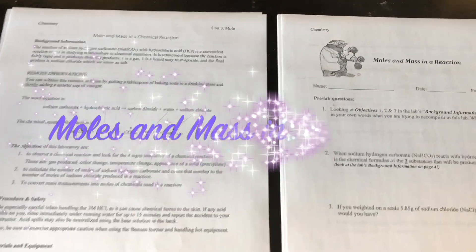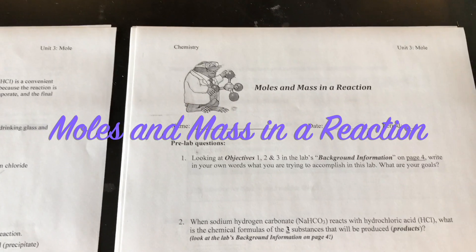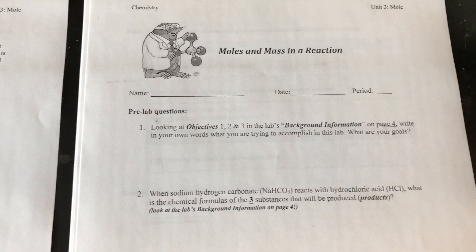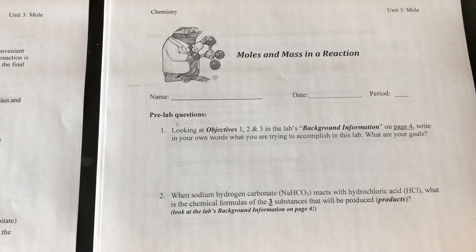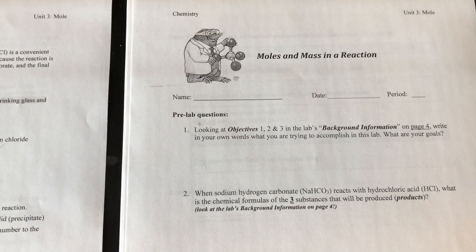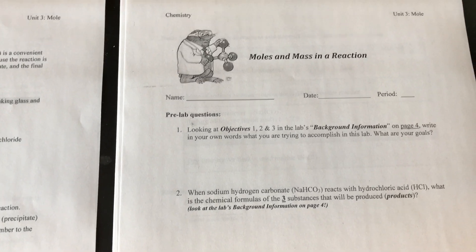Welcome everyone to our lab on moles and mass in chemical reactions. This is going to be our introduction to what is called stoichiometry, which is just using ratios of moles in chemical reactions.